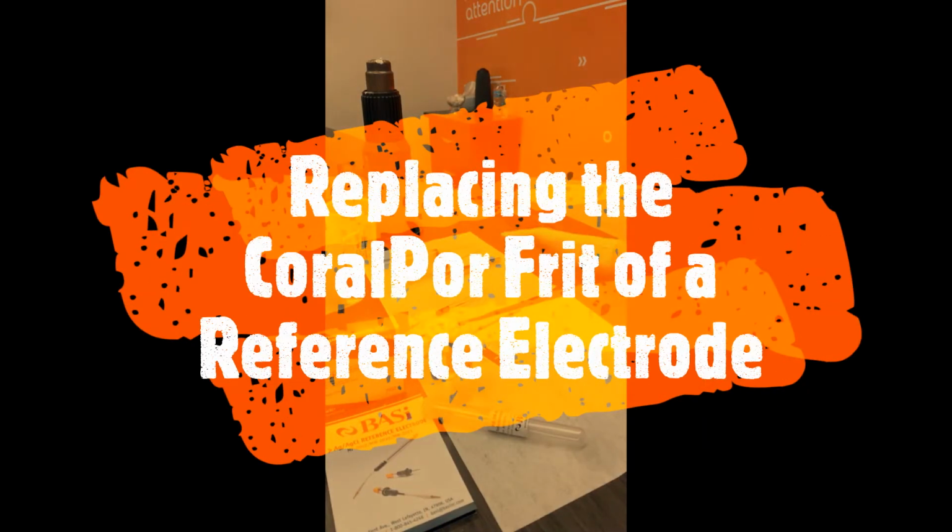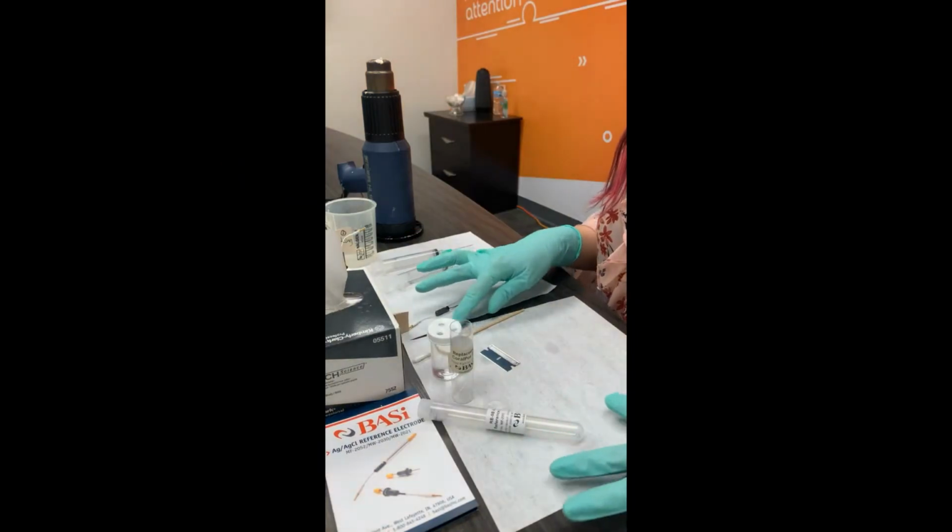Hello everyone, today I'm going to show you how to replace the CoralPor Frit of your silver chloride reference electrode.